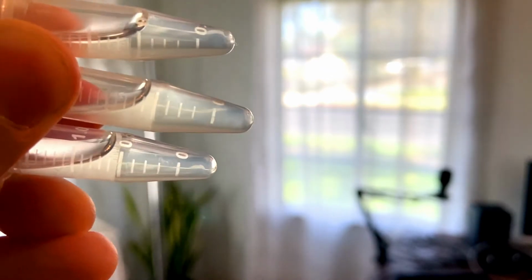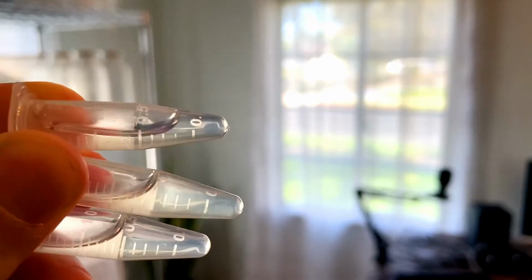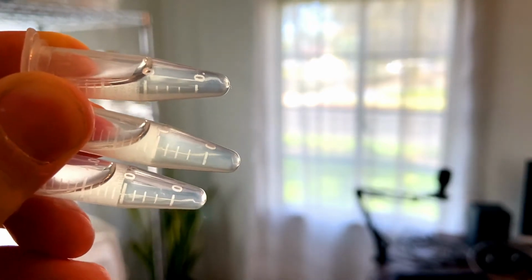Now, the top one and the bottom one don't have it, so that means the colonies for those plates were not kanamycin resistant, but the middle one was. And that's good because that means that our electroporation attempt worked, but we still have a couple of issues. So let's go over those issues and how we're gonna work to resolve them.